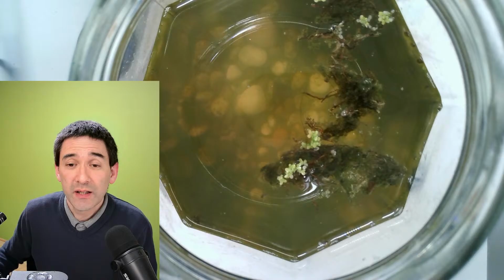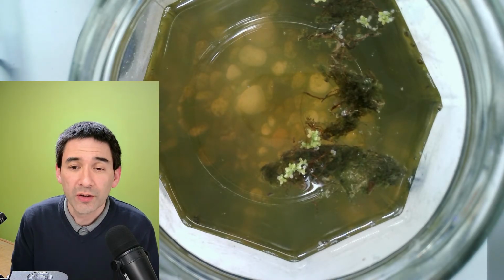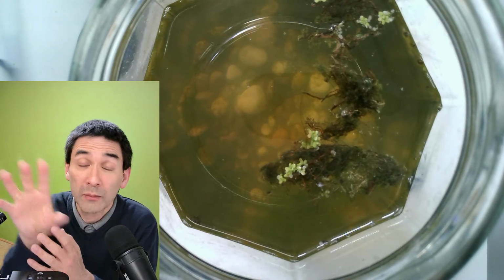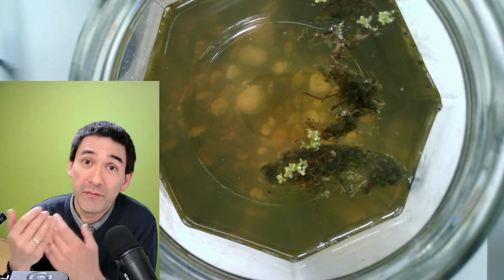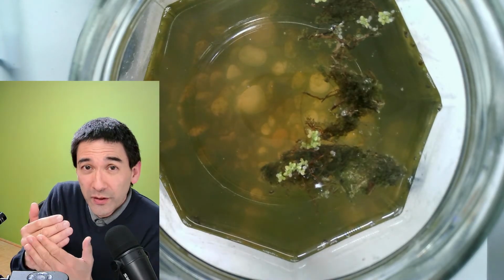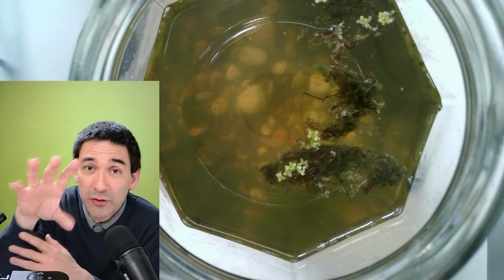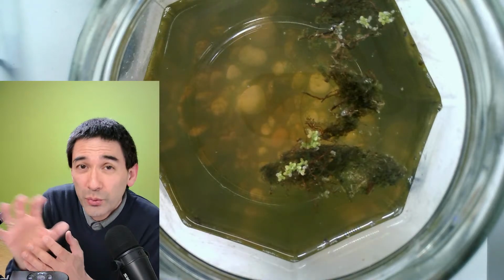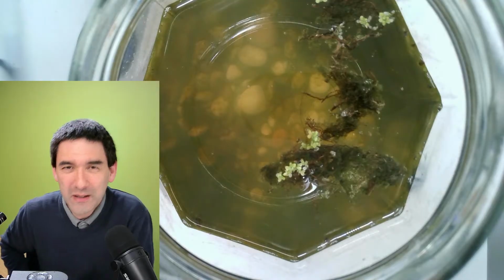But that would be a nice thing, because I know that there are quite a few programs already out there that allow you to do some kind of virtual zooming. It's like Google Maps for microscopes, so to say. You can navigate around and zoom in. Very nice. To make this very smooth, the high-resolution images are split down into lower-resolution images, which load faster. So you get a very smooth experience. But of course, adding some kind of focusing layer to it would be interesting as well.